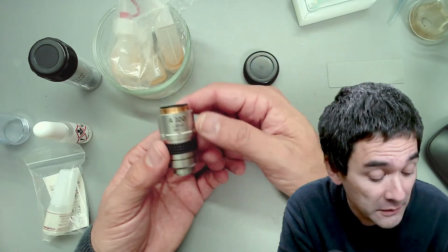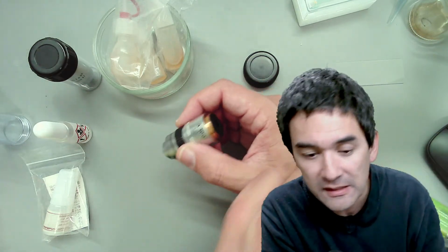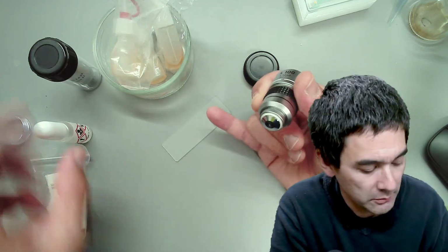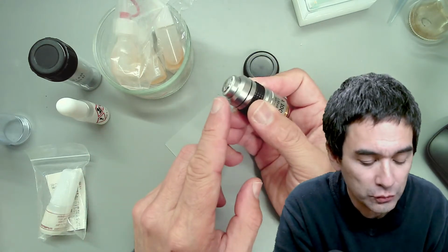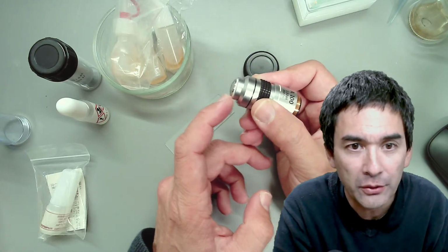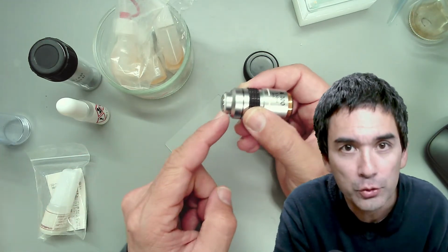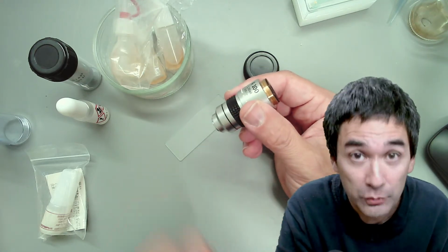And for those of you who are completely new to oil immersion microscopy, it works like this. I've got a slide over here. I'm just going to use this slide. In oil immersion microscopy, you put a drop of immersion oil, I've got some here, directly on the slide. And then you rotate the objective into the oil. So this means that the front part of the objective will be covered in oil, so there is no air between the slide and the objective. And this increases the resolution.